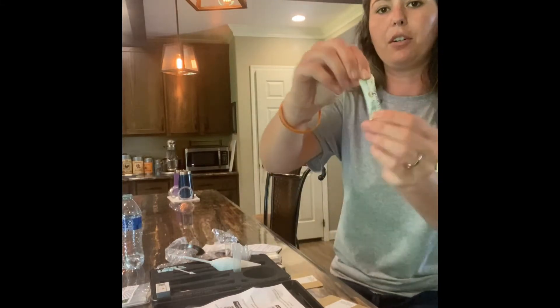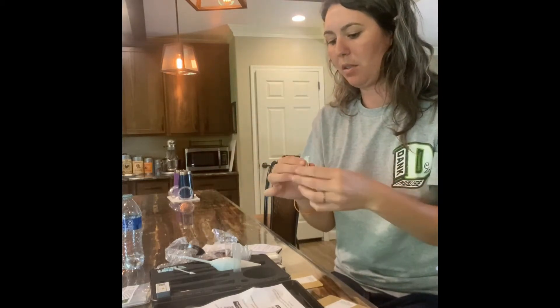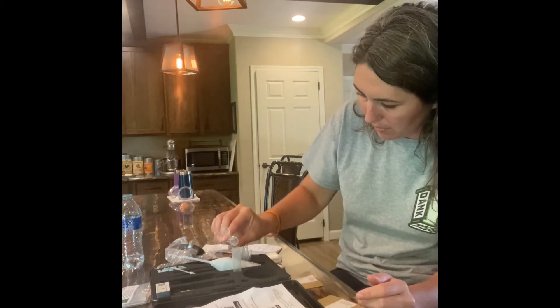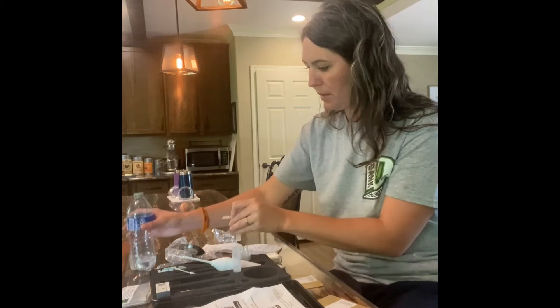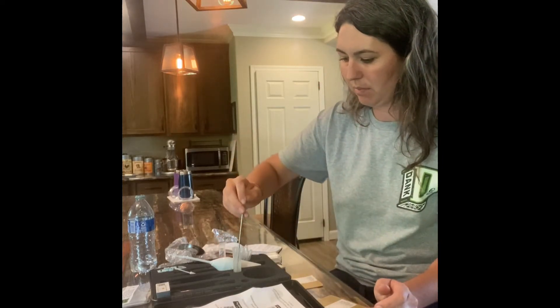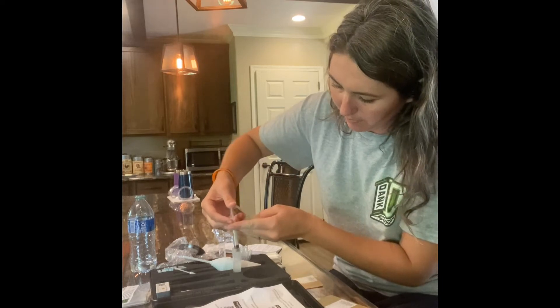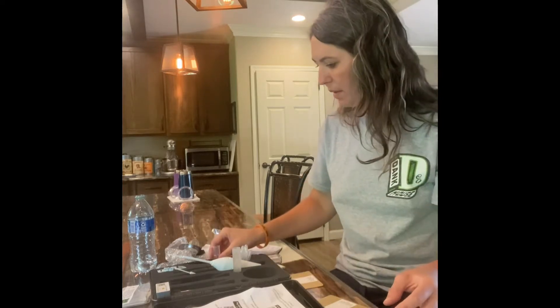We need the little microbiometer extraction powder. Go ahead and rip the top off, pinch it on the side so it opens up, and pour it into the tube. Fill it up with water — I'll do a little bit more, it looked pretty much full in the video. Pour a little bit more water in and break it up.